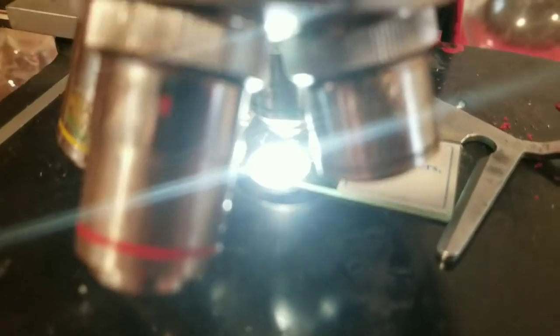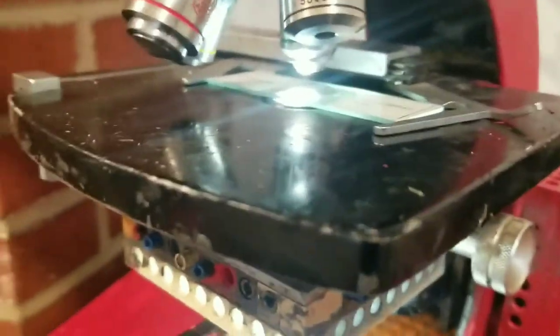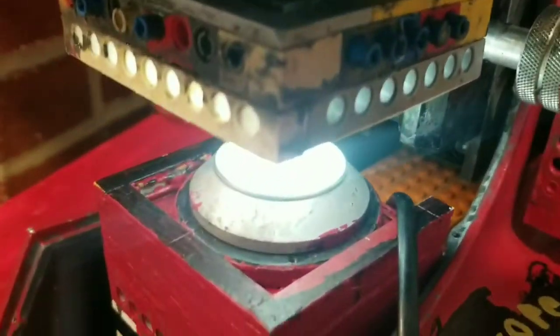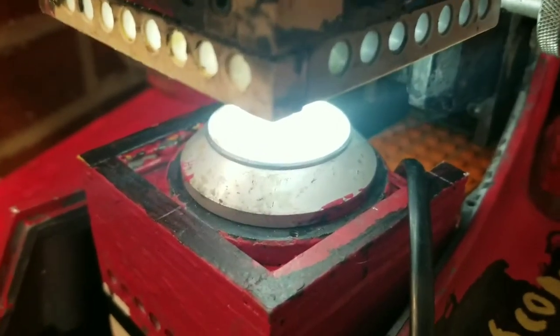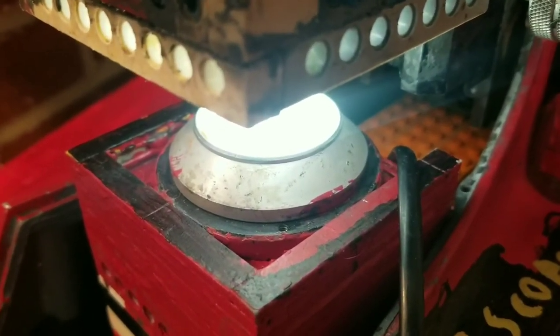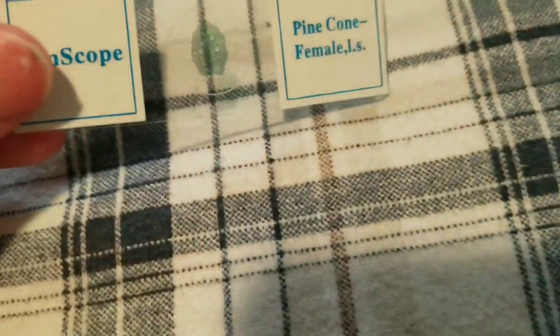I'm going to check it out at higher magnifications. As you can see, the background is black, but the nylon fibers appear as blue. So anyway, this is one method of dark field illumination microscopy, which causes specimens to appear brighter on a dark background. The reason you would want to increase contrast in a specimen, this can also be seen with most specimens, such as pinecone female.